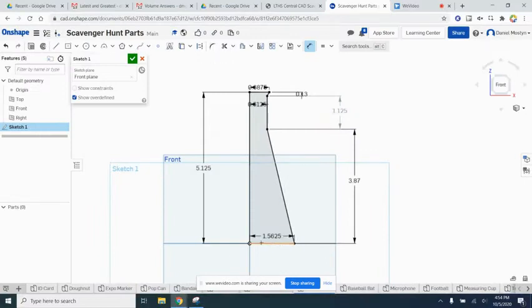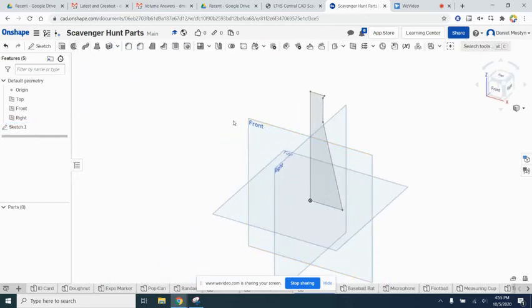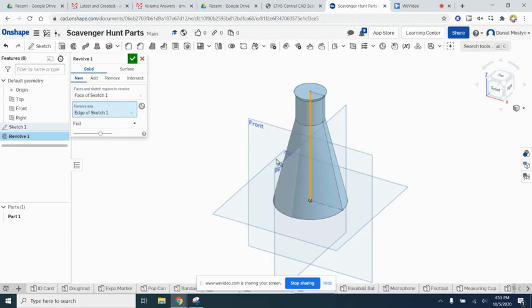So that's great. There's no blue lines anywhere, so that's another hint that we've done our job and we can go ahead and revolve. If there's any blue lines or any blue geometry, that means it's not totally defined and you're missing either constraints or dimensions. So we'll finish this off. And let's go ahead and revolve it. I just chose the sketch we drew, and the middle here is our axis.